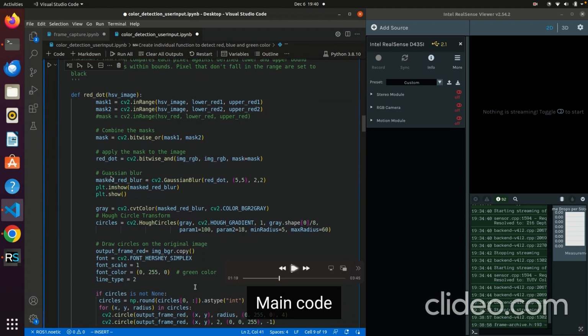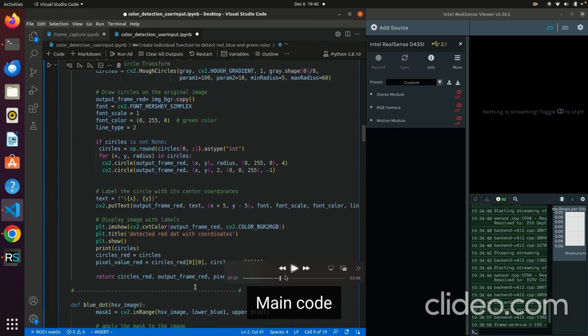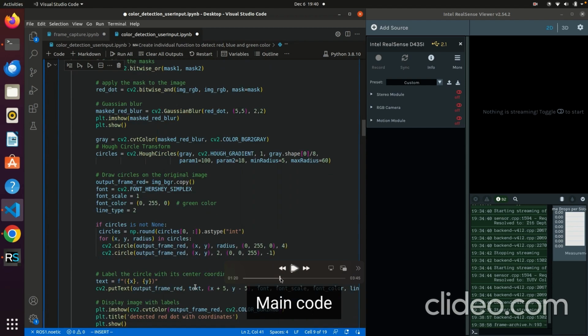And then for further noise clearance, you get the red dot image, and you use this kernel size to clear up a lot of noise in the image. Here, after masking, you need to convert the image. First you will get the mask image in the CV color function, and then you convert it from BGR to a grayscale image.